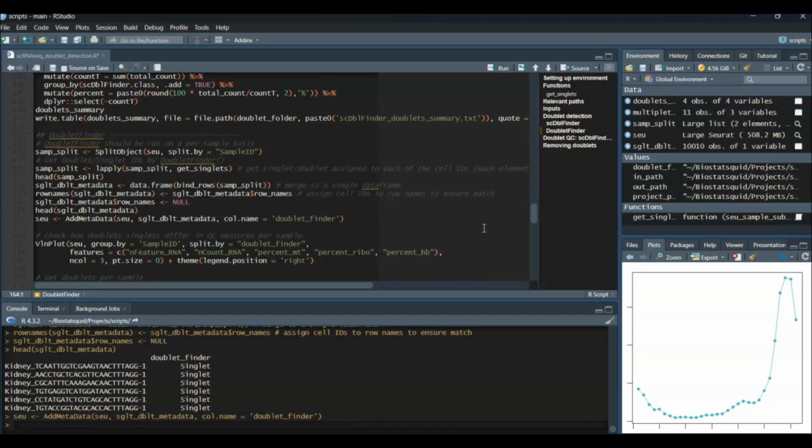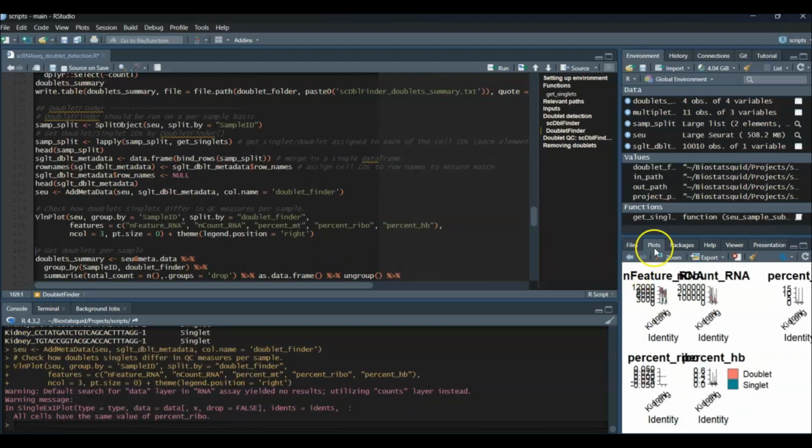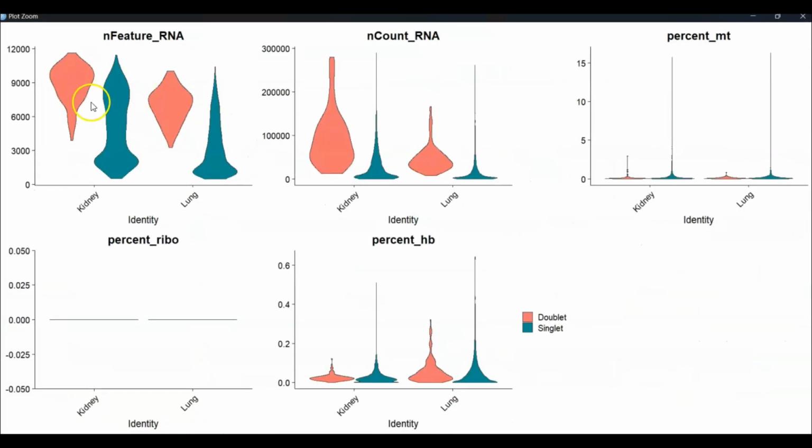Nice. So we can also have a look at violin plots with different QC stats as we did last time, which separate the singlets and doublets. So as you can see, again, we expect cells marked as doublet to have a higher nFeature and or nCount, probably both, compared to those marked as singlets. Whereas there shouldn't be such a big difference in the ribosomal or mitochondrial genes.